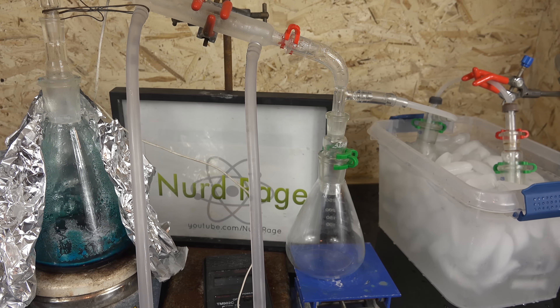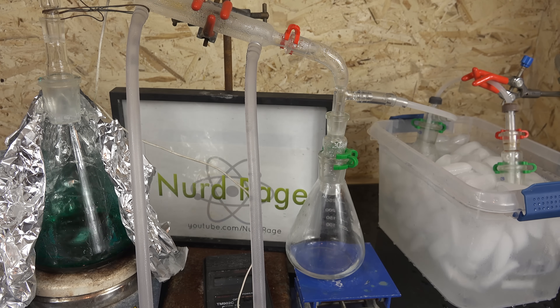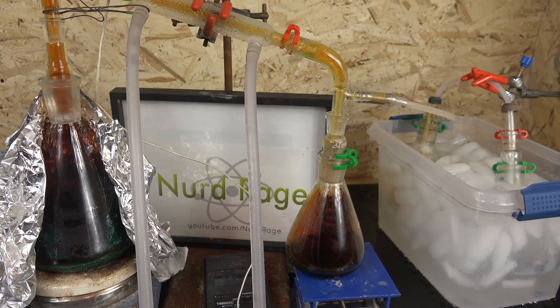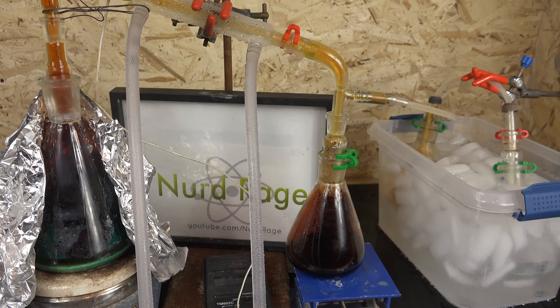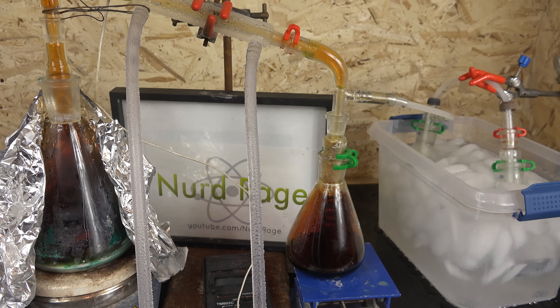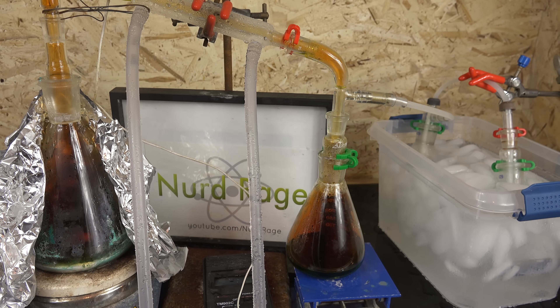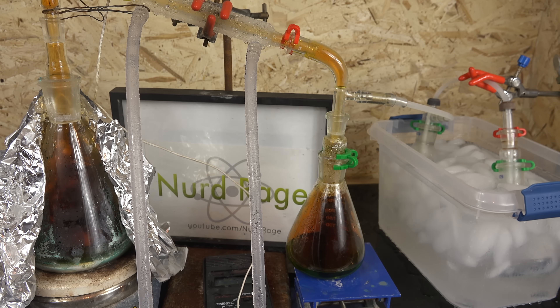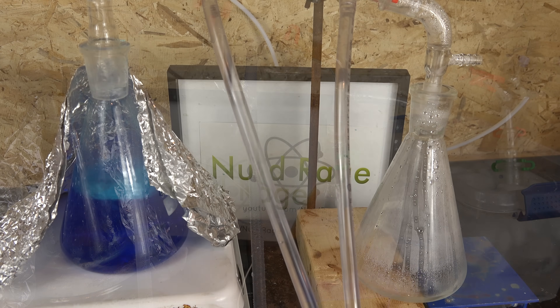Greetings fellow nerds. In a previous video I demonstrated how to use copper nitrate to generate nitric acid without needing sulfuric acid by thermal decomposition. Interestingly, I got a large number of comments from precious metal refiners who had large amounts of copper nitrate waste and wanted to know if the process could be used to recover their nitric acid, and if there are other processes than just thermal decomposition.